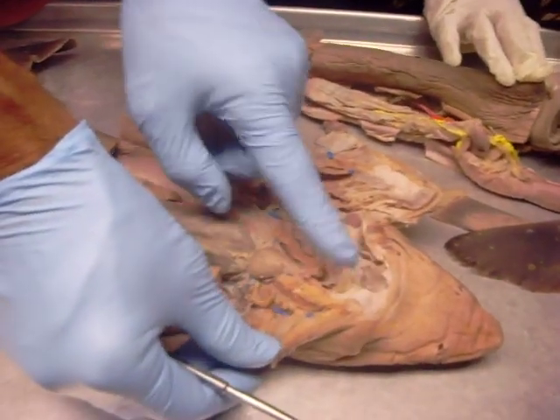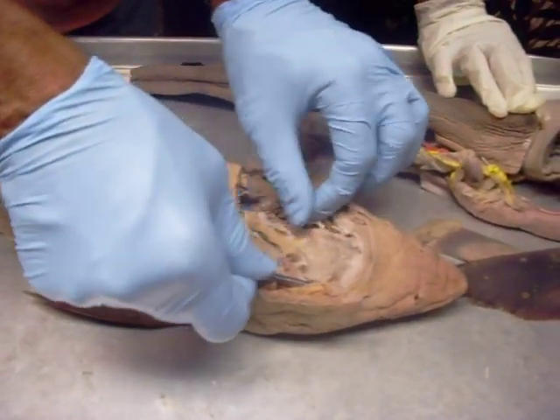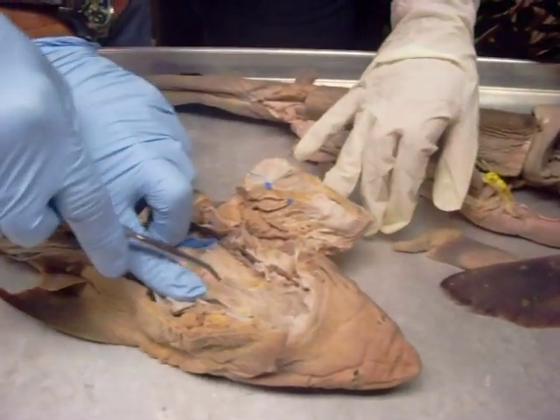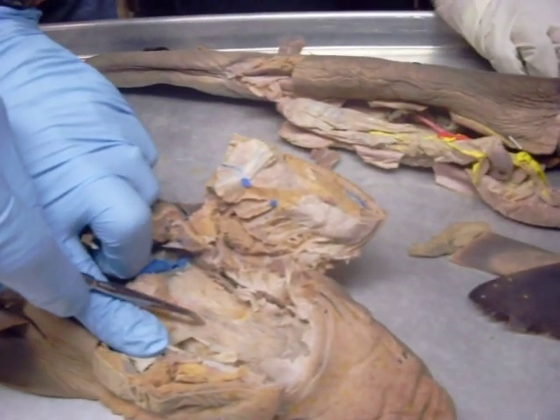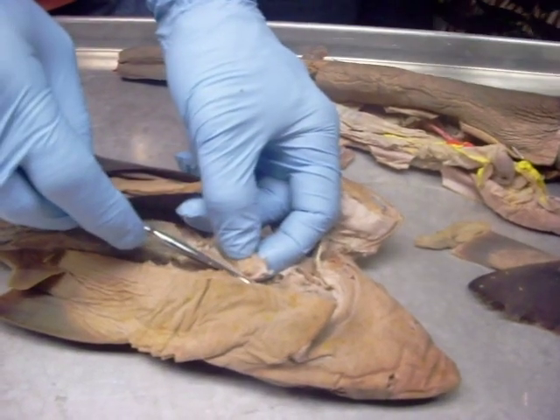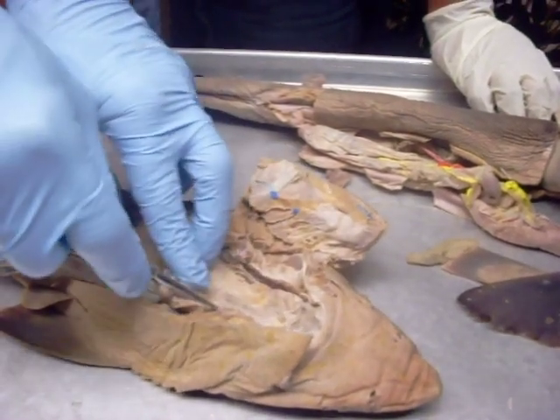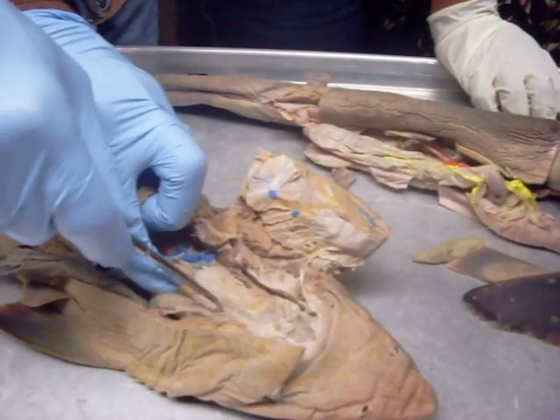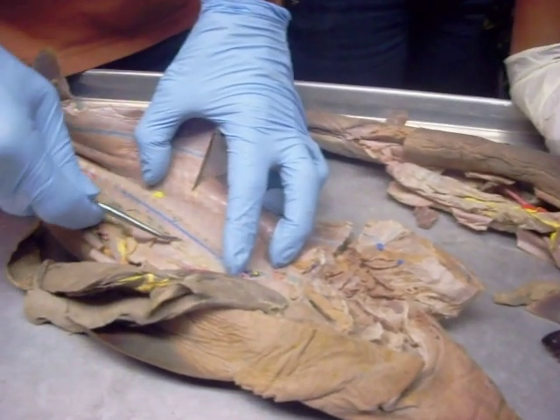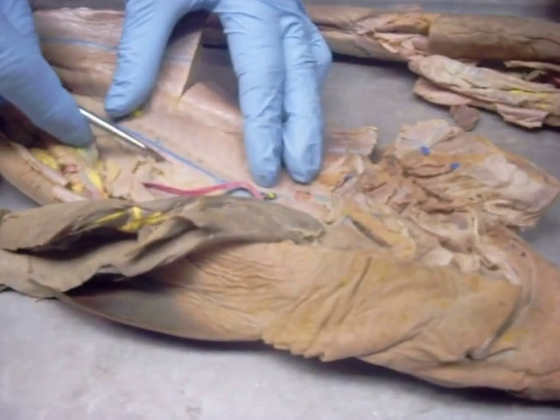The blood then goes through the gills, and the blood is going to come out of the efferent arterioles. There they are right there — that's an efferent arteriole. So the blood is going from here into the ventral aorta, oxygenated in the gills, then coming by way of these efferent arterioles, and what they're making is the aorta. This big giant blood vessel right here is the aorta.